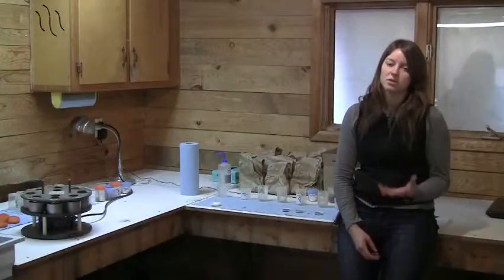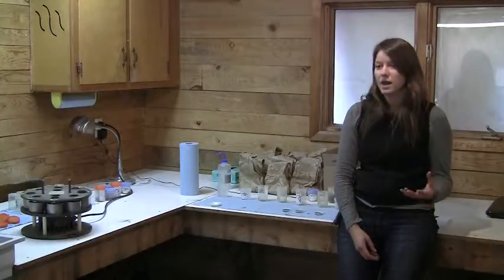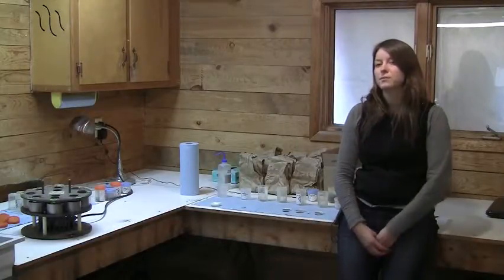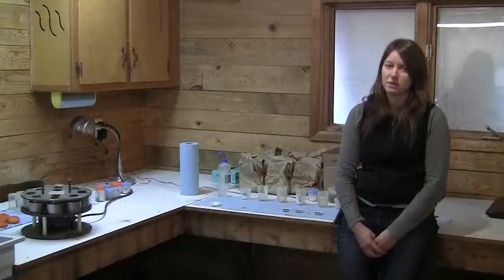A lot of those samples we've sent out for nutrient analyses, which we can use to determine the quality of the soil and also what kind of vegetation would likely be able to grow there. An in-house quality of the soil that we're going to be looking at is aggregate stability, and we can do that here. It's a really simple method, using a wet sieving apparatus.